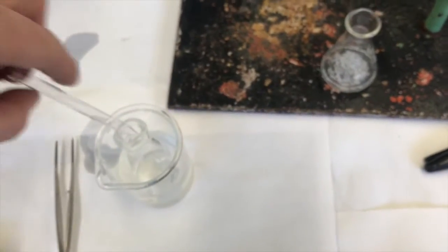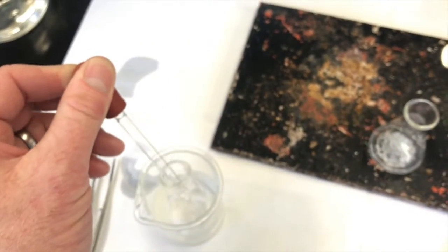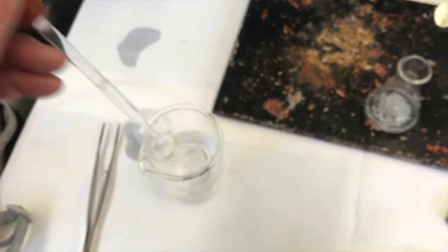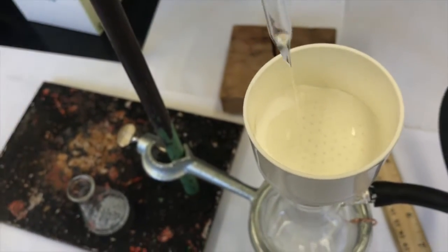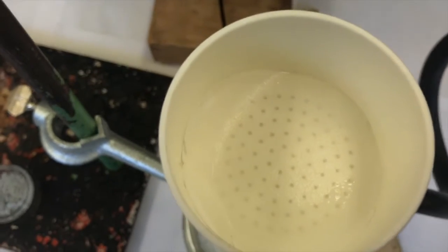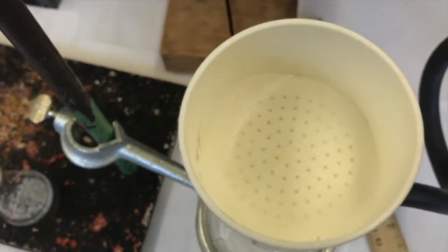And now to do this, I want to initially wet the filter paper down with some of this methanol, and then when I turn on the vacuum, it'll suck the paper down good to make it so that I won't have exposed little holes that my crystals can sneak by and get into the mother liquor.